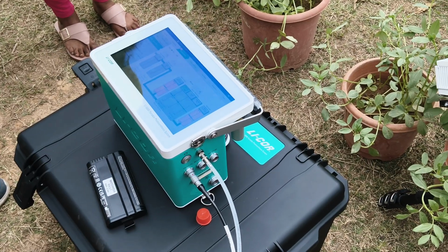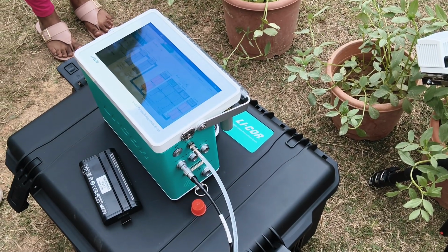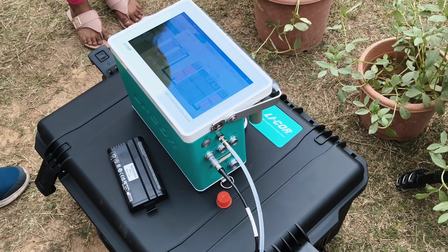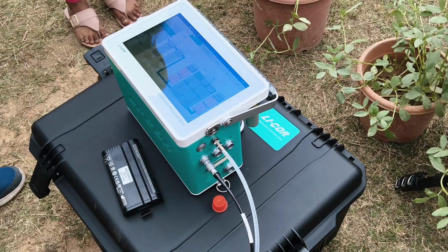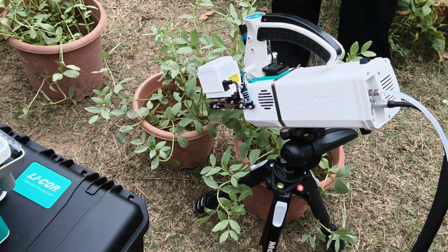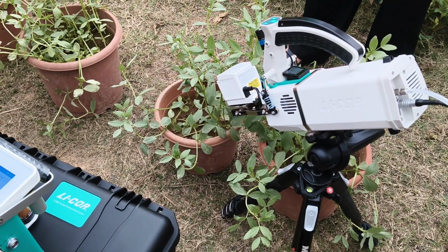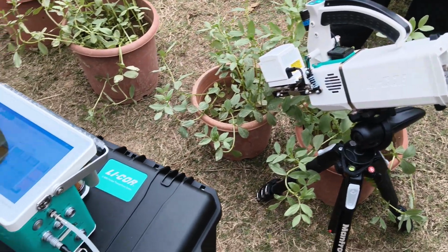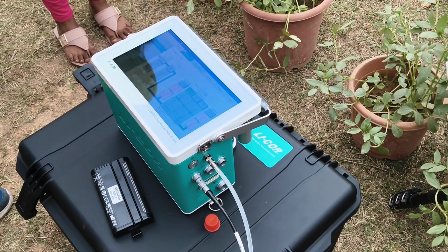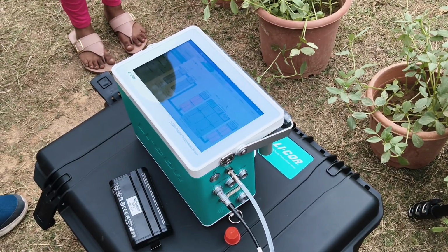In this system, you can either make a similar range of ambient conditions, or you can increase the range to check the saturation point of the plant. There is also a separate fluorometer that can give you photosystem 2 parameters, like ETR, quantum efficiency, quantum yield, zero fluorescence, maximum fluorescence, and non-photochemical quenching. That instrument is also provided by PSI.